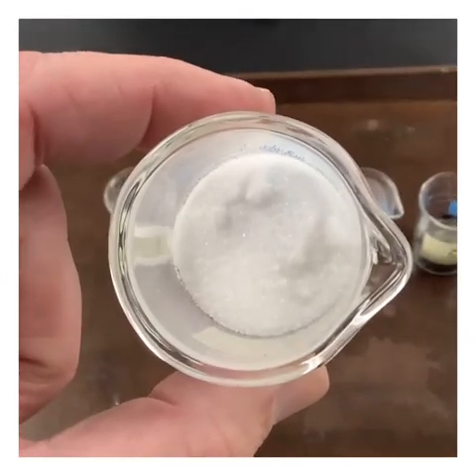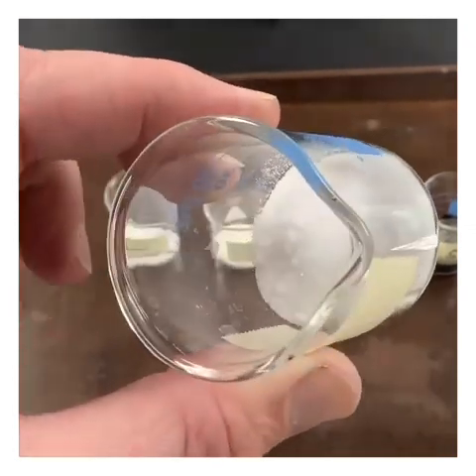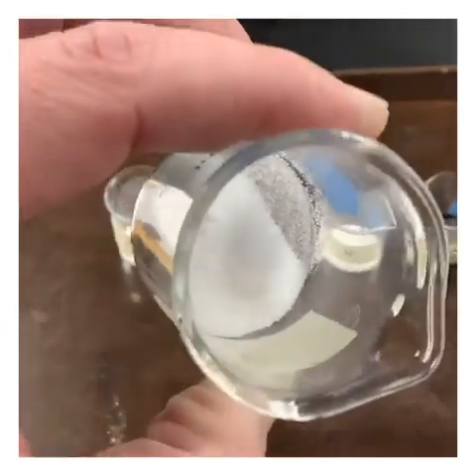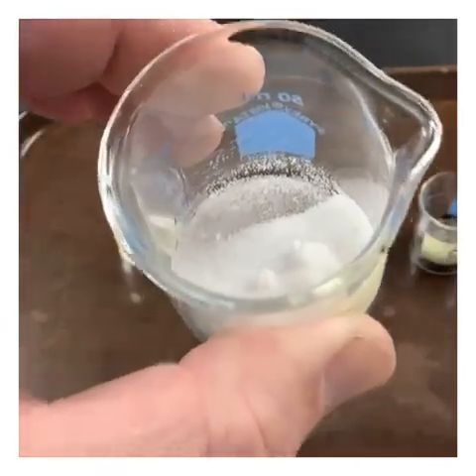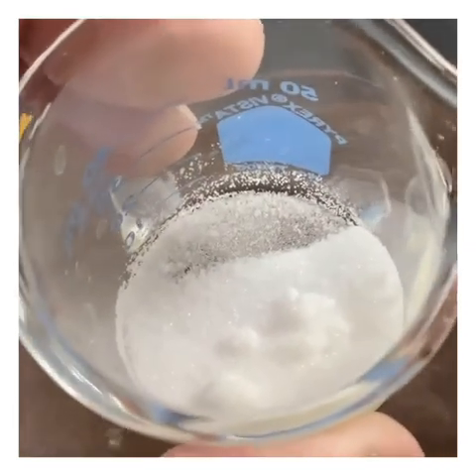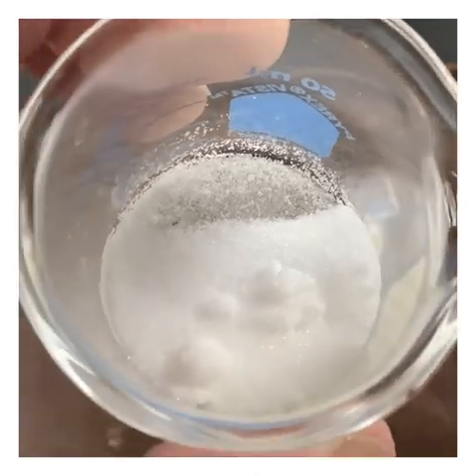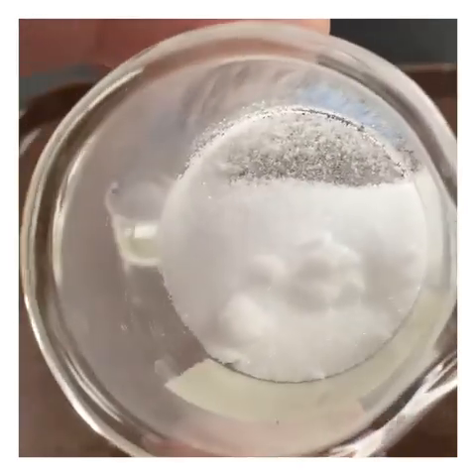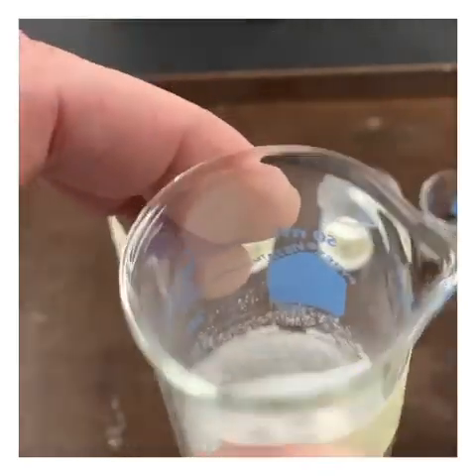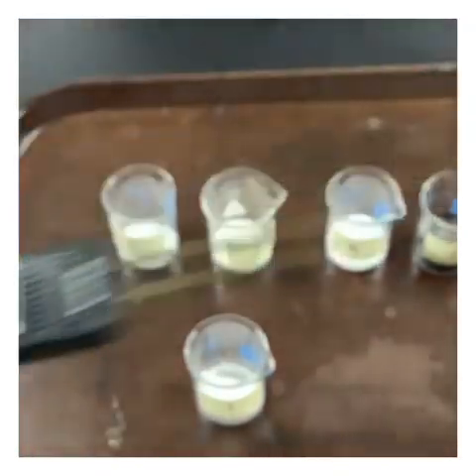Taking a look at chemical number 1 here, see if we can get this to focus. There we go. We can see chemical number 1. Kind of roll it a little bit. You can see it's sticking to the sides of the glass a little bit. So you guys can make some observations about this one. All right, the next thing that we want to do is try and test the conductivity as a solid.